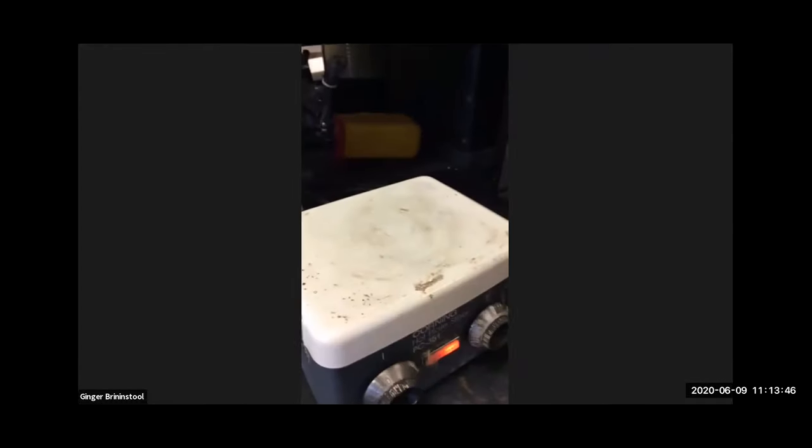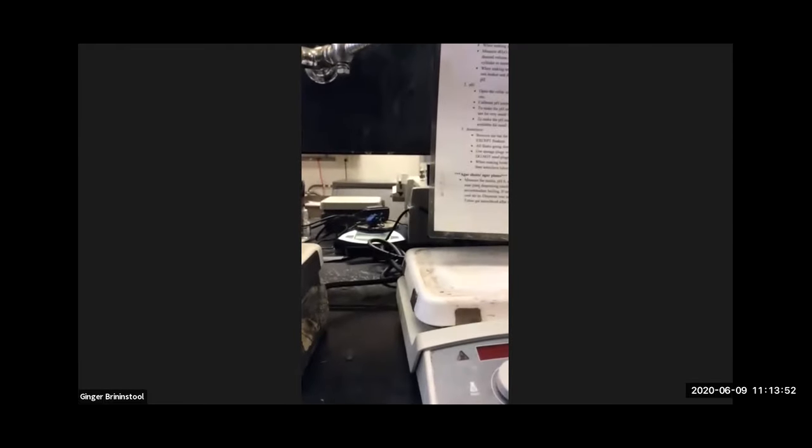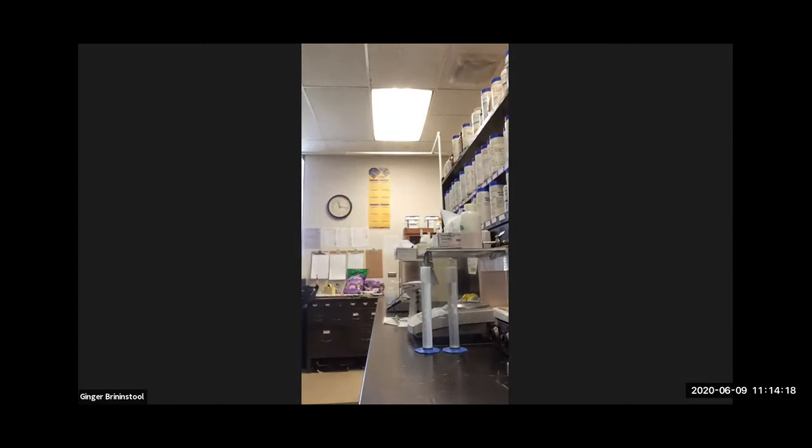Here's a clean hot plate by comparison. We're going to need two because we're going to make two different ones. We're going to make nutrient agar and we're going to make nutrient broth. And for that, then we'll need both. We'll need some other ingredients too. And so we'll need things like flasks and aluminum foil. We'll need stir bars. We'll need some spatulas. I need to get a couple of weigh boats out.